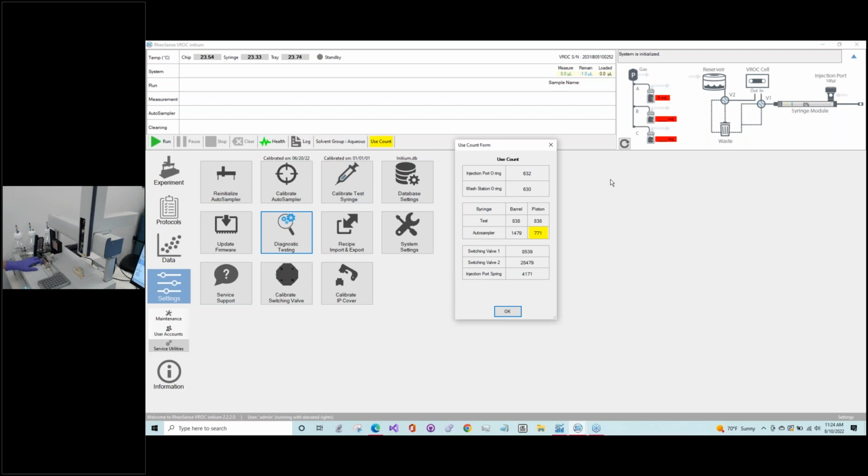And that's particularly true, a side fact, if you do a lot of temperature sweeps over the full range of the instrument, say from 4 to 70, cycling over that range over and over again. If that's a test that you do routinely, then you might want to keep a closer eye on the piston, and particularly the tip of the piston, as it can deform more rapidly over time.